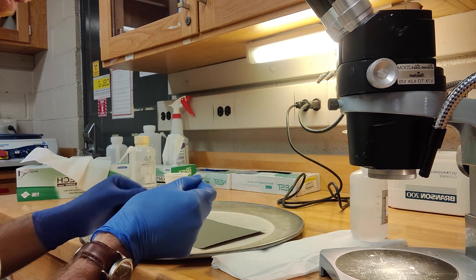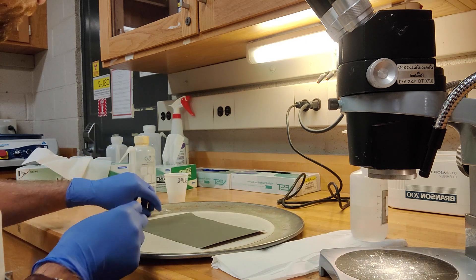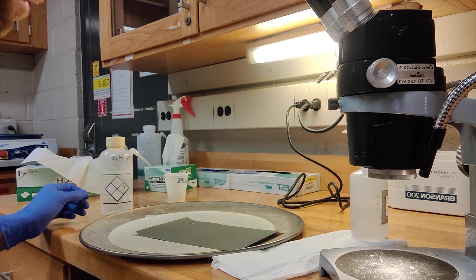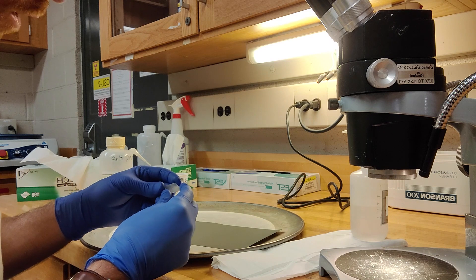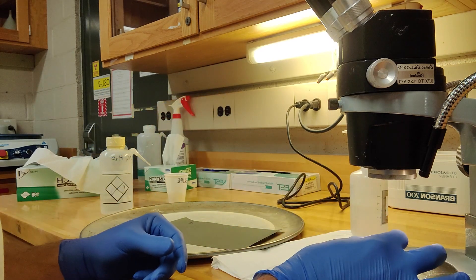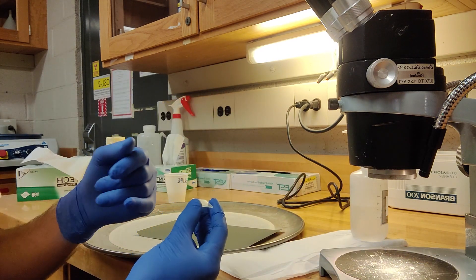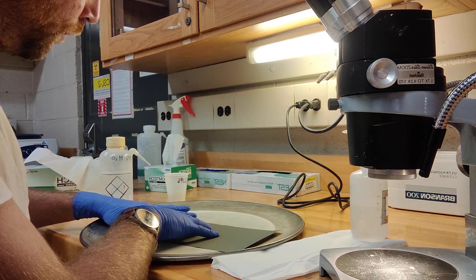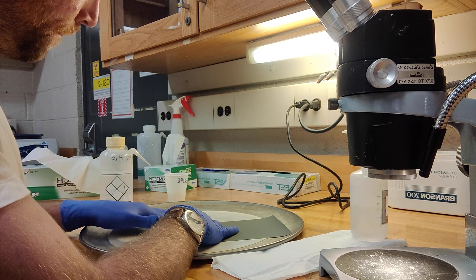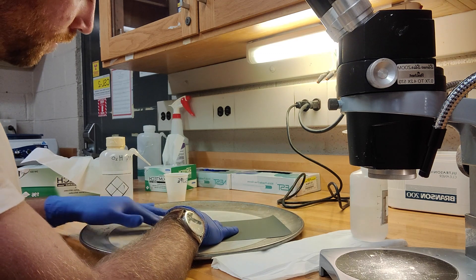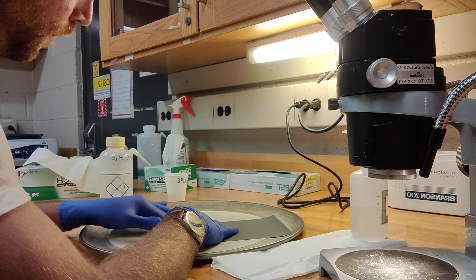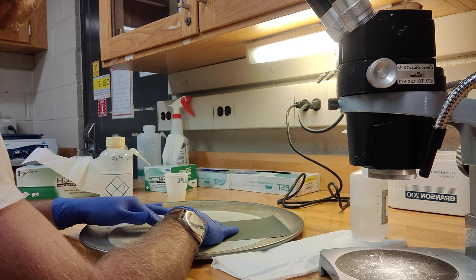So the first thing you do is pretty straightforward. You take your sample, you put a bit of water on your grit paper like such, just a droplet, and then you make sure you're polishing the side with the apatites. If you don't know, you can check under the microscope. And all you do is just push it down firmly, you just do either little circles or hopefully figures of eight. That should expose the apatites for their internal sections, and this is probably where you want to do most of the grinding.